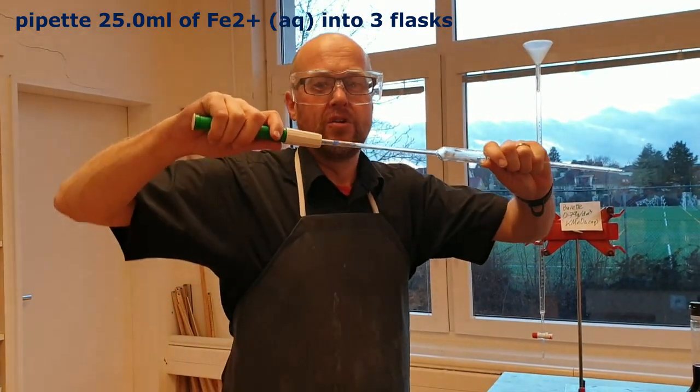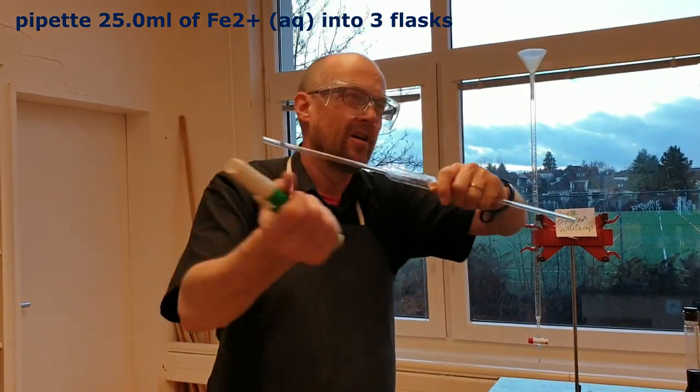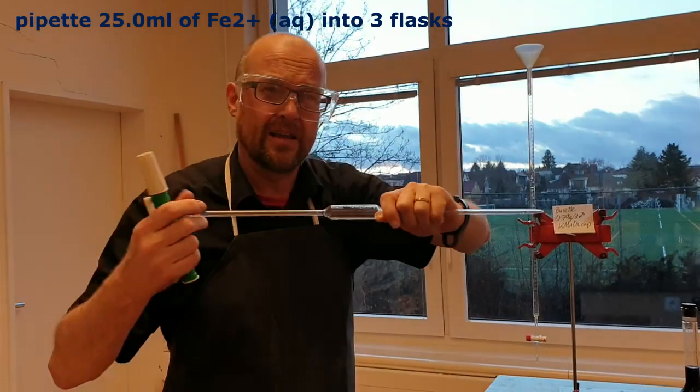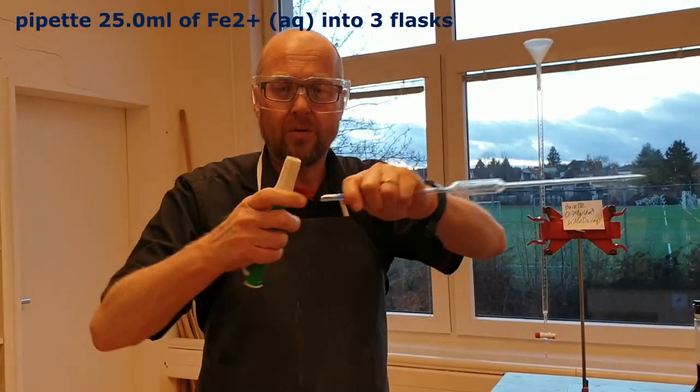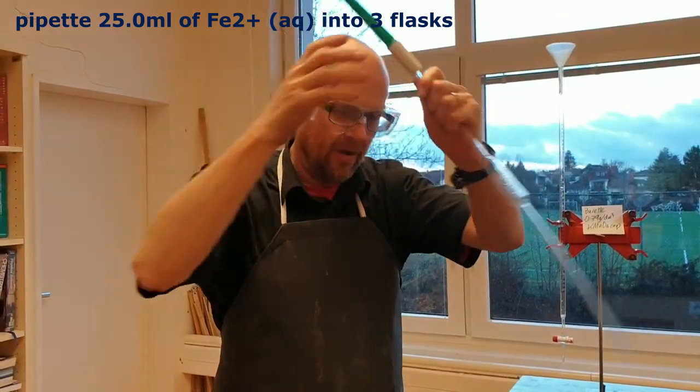This is also bad. You could force it in, snap it, and then you've got a broken piece of glass straight across the wrist. Arterial spray up on the ceiling. It's grim. So hold it close to the end and jam it in like that. Okay, here we go.